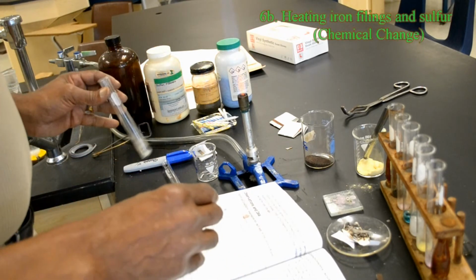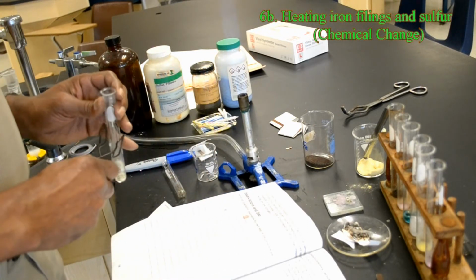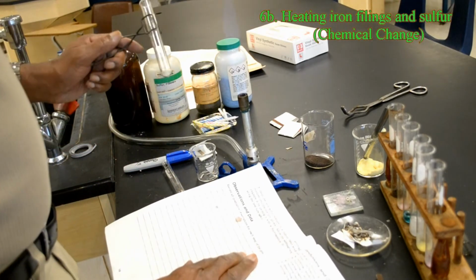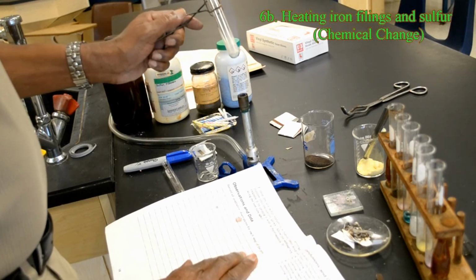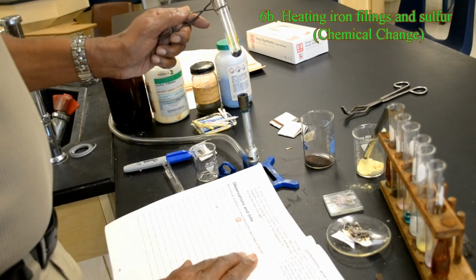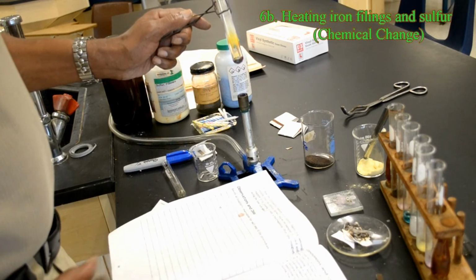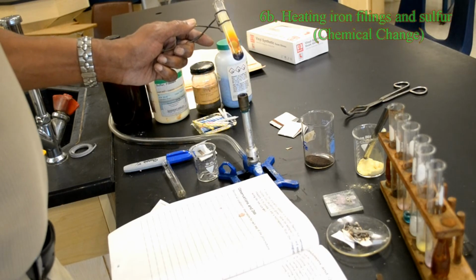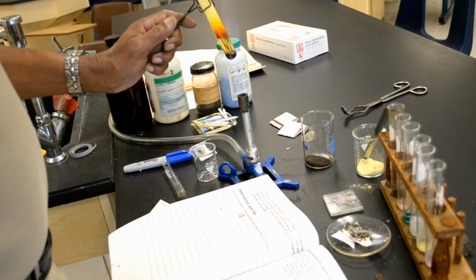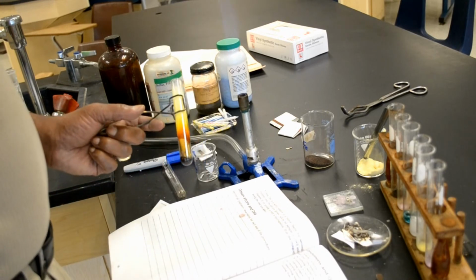In the final step, we're asked to heat this iron-sulfur mixture in the burner flame for several minutes until the mixture glows. Then run a magnet along the test tube again. So I think my sample is glowing now. Now I'm going to let it cool.